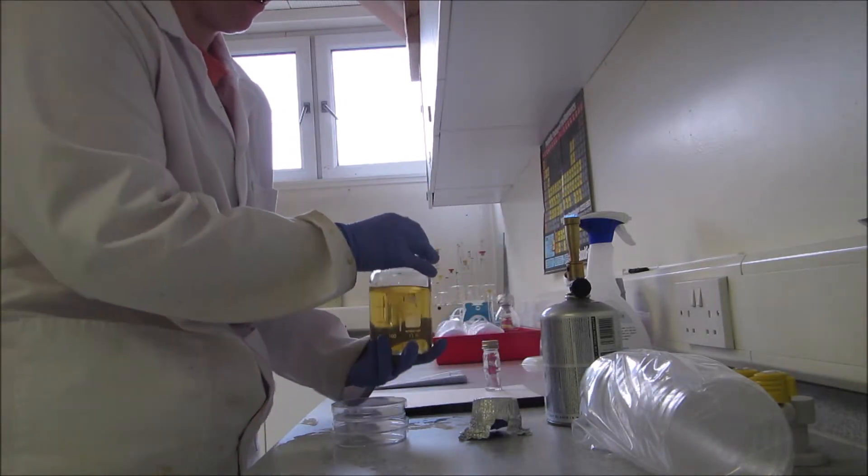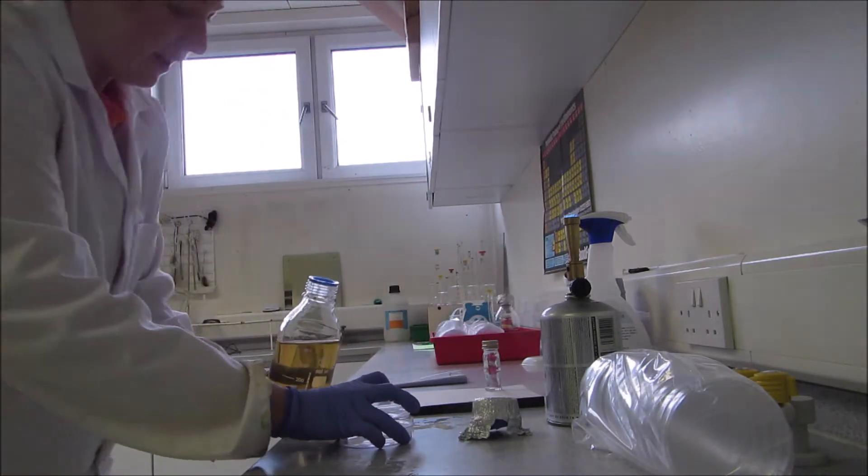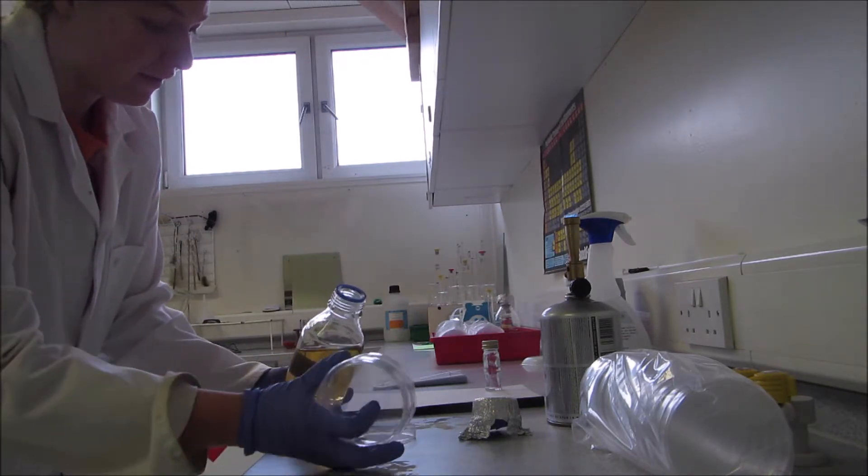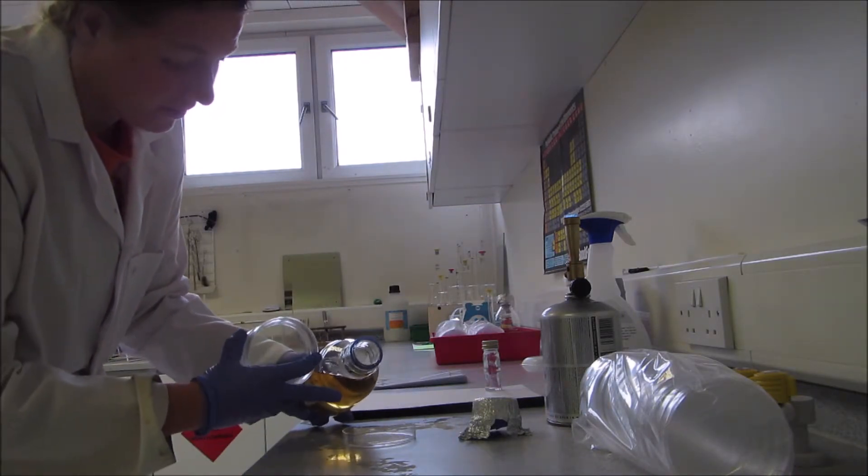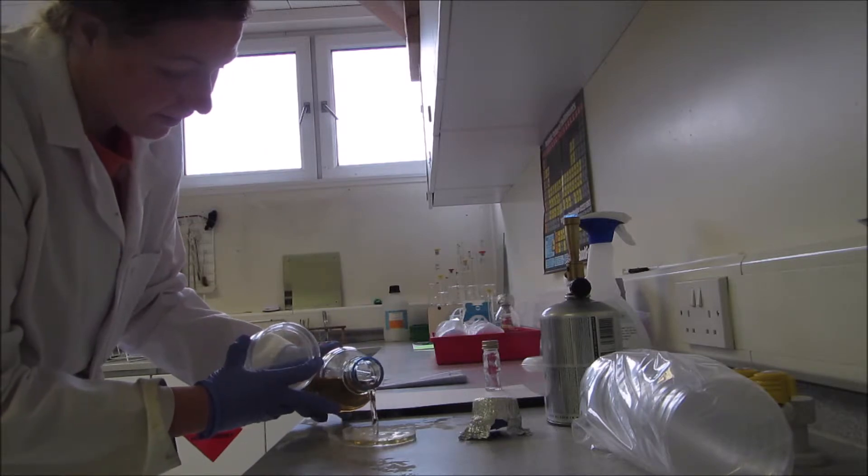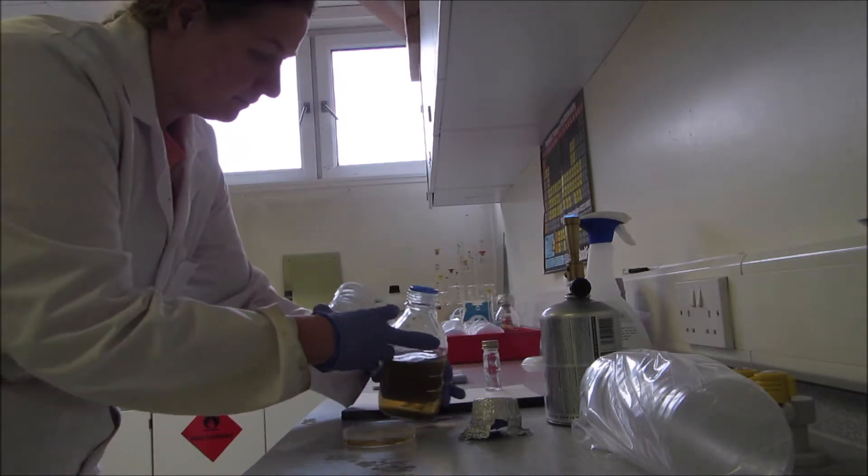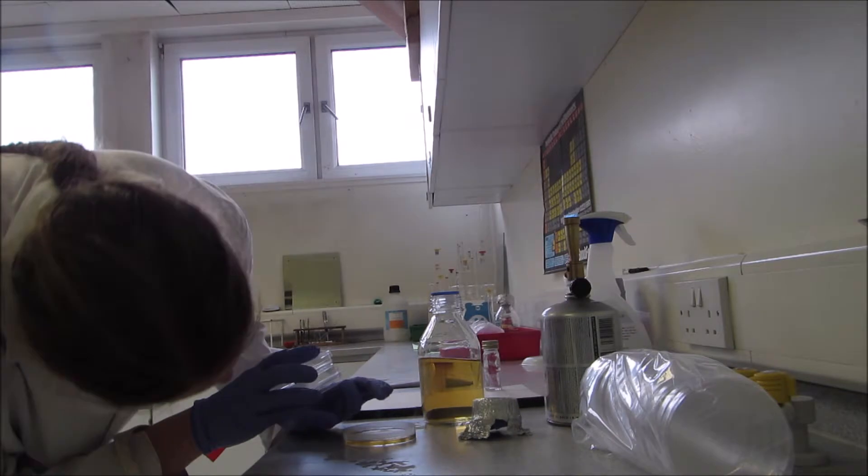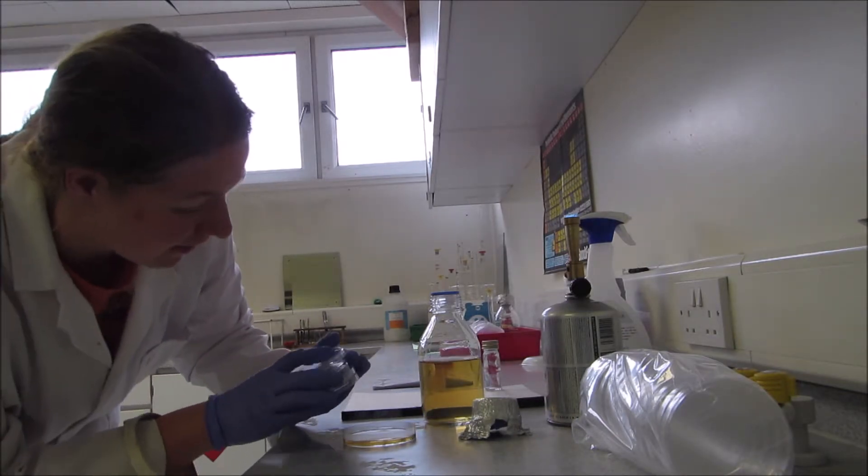Then I'm going to lift the agar. To show you what I'm doing, I'll take my hand away. You can see there's a depth of about half of the agar plate.